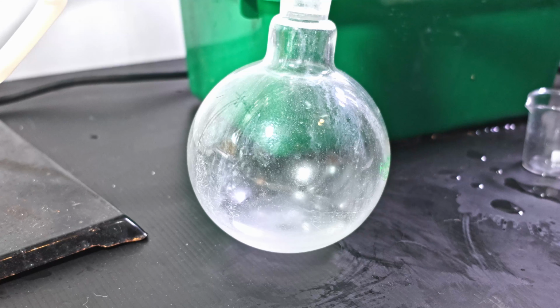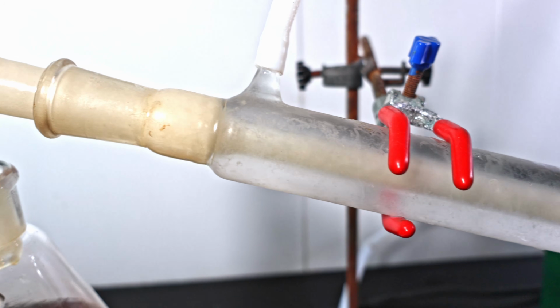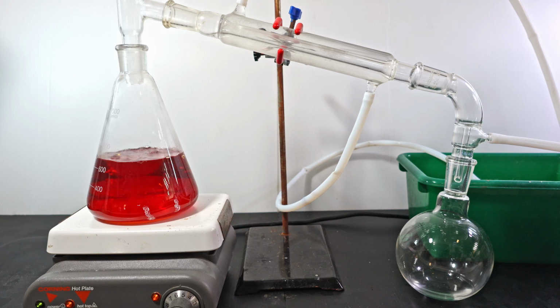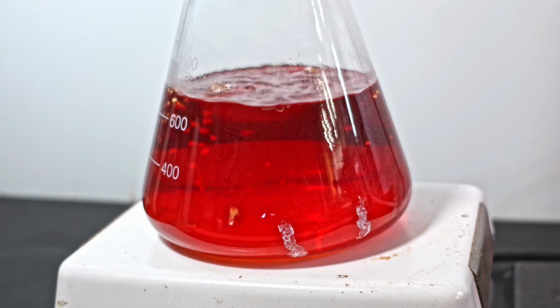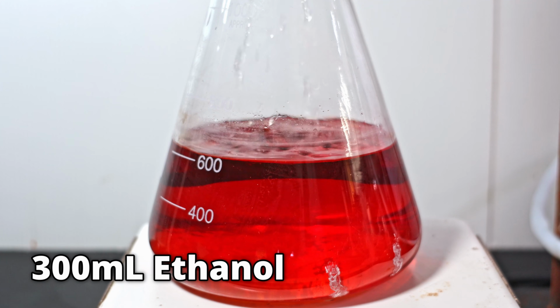I get some distillate in the meantime. Later, I find that the mixture had boiled so violently and plugged up everything. I put as much as I can back in before resuming. The solution has now turned a blood red color. I distill without vacuum to kind of drive off the methanol naturally. When the solution struggles to boil, I add 300 more milliliters of ethanol.